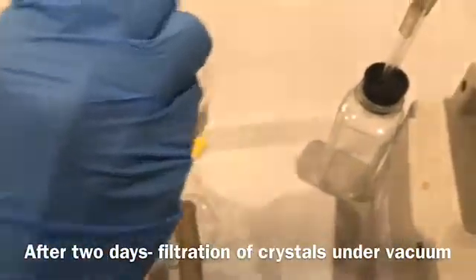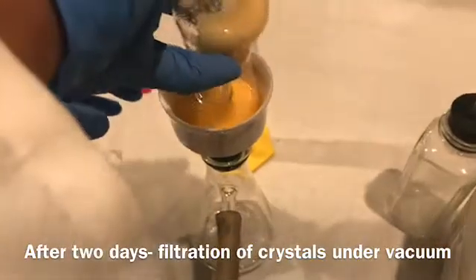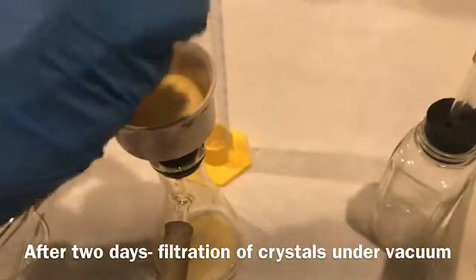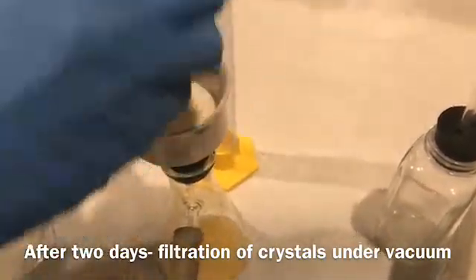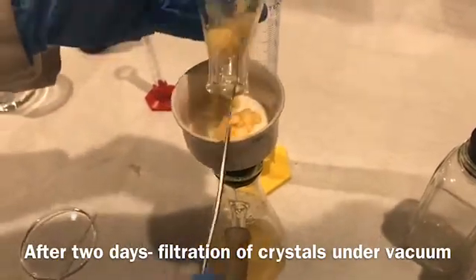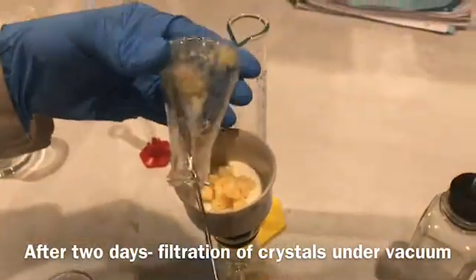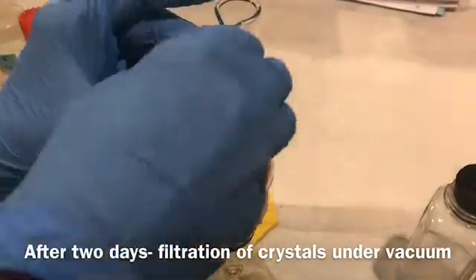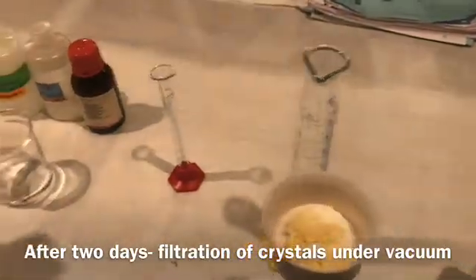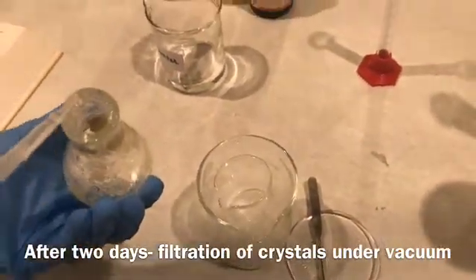The Büchner funnel is ready — I already wet the filter paper. Here I have 10 milliliters of ice-cold water which I will use to wash the crystals.